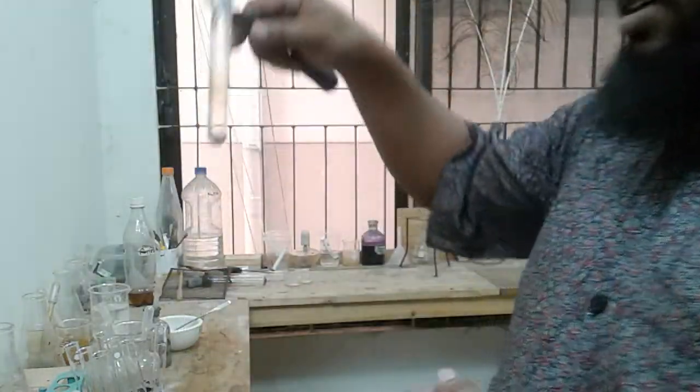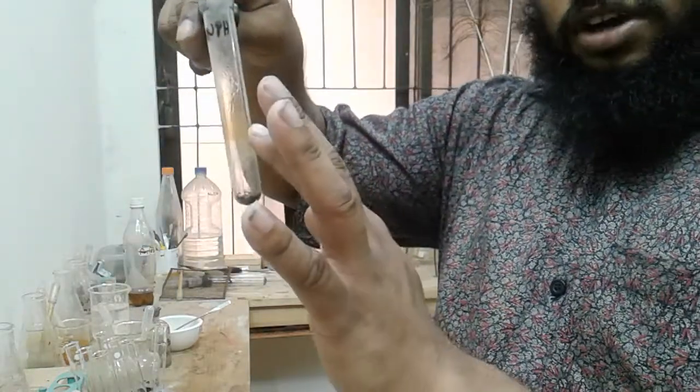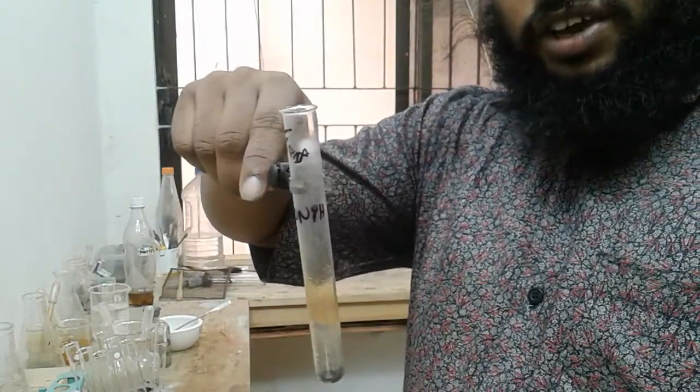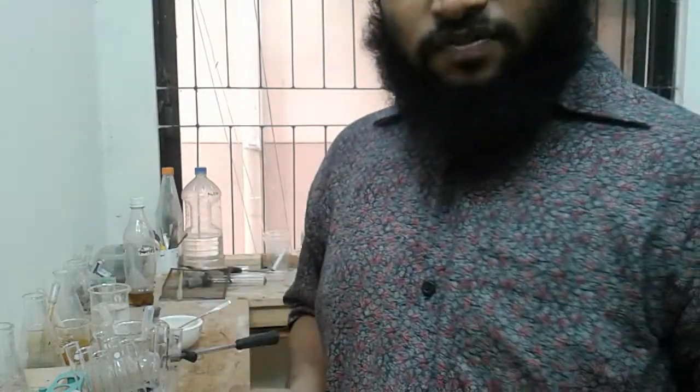In this case, don't be confused, the test tube was initially brown. It's not a brown color gas, but the gas we have found coming out has got a white color, or we can say it's colorless, because already some water was present over here. So that may be the evaporation of water, but the gas itself is colorless.